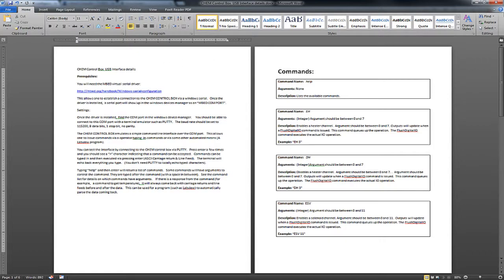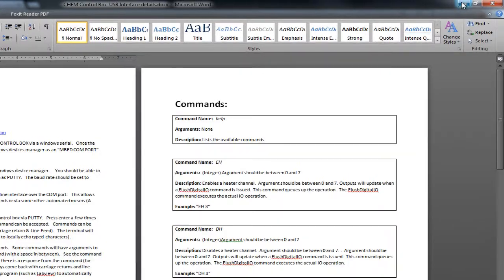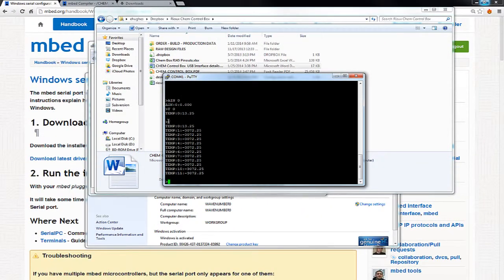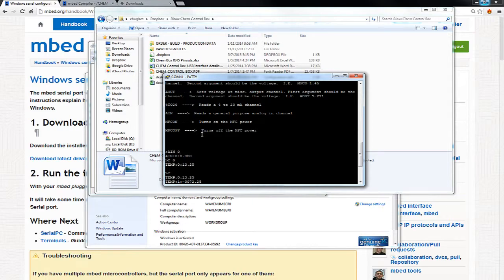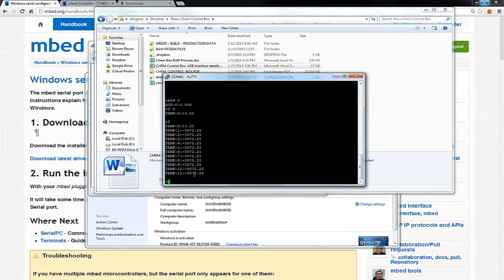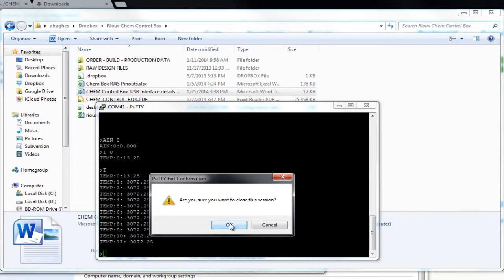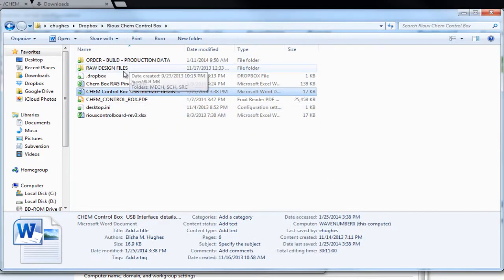So let me minimize this, or let me just get rid of it. So what I did from here is to kind of show you how to do it in LabVIEW, is that I gave that document because it basically tells you all the commands you send. So each command you send a string with a character and a line feed, and it always just returns another string with data that you can parse. So I'm going to close PuTTY here. Yes, I want to close.